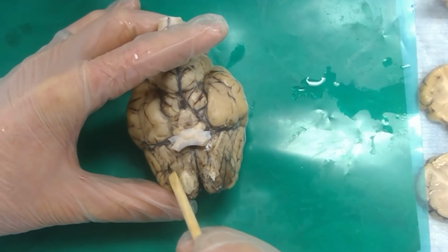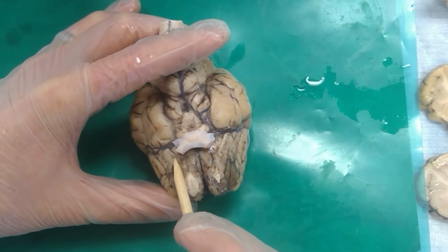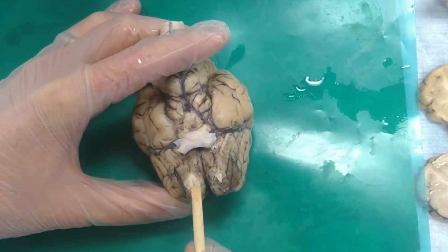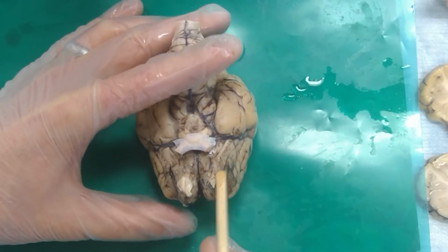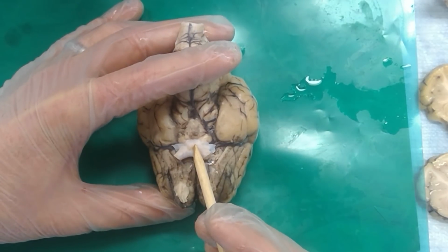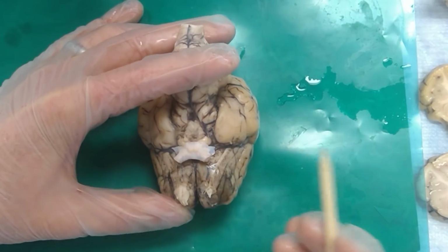Okay. All right. So what is this gyrus right here? Lateral olfactory gyrus. Right, and this little white stripe going along the side right here? Lateral olfactory stria. Okay, and what is this cranial nerve? Olfactory bulb. Right, and then this cranial nerve? Optic nerve. Which then crosses at the? Optic chiasm. And then is called the? Optic tract. Correct, all right.